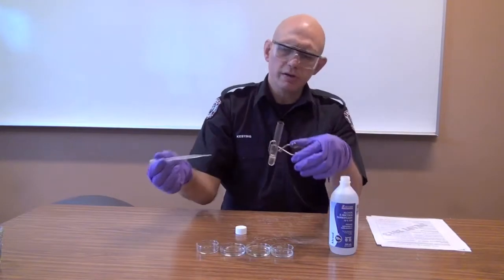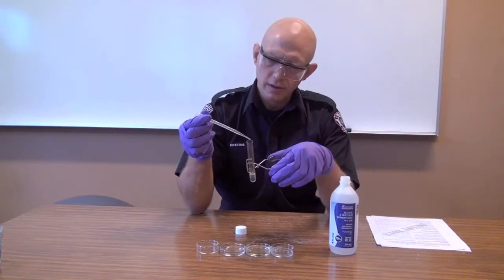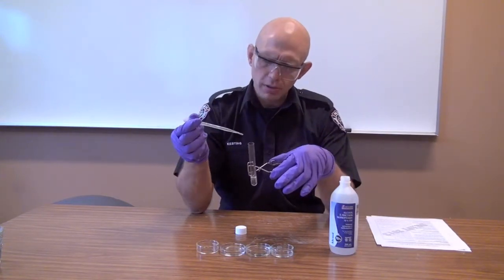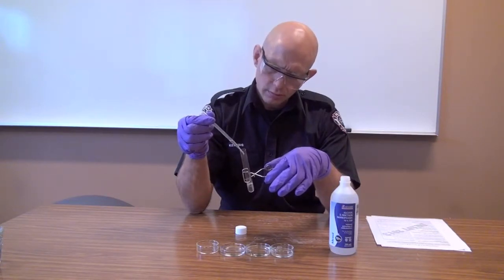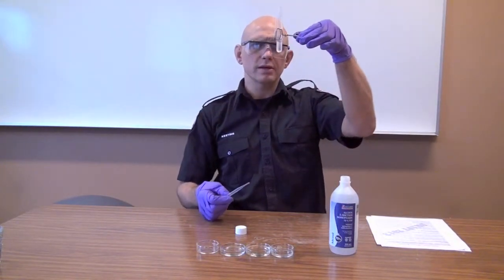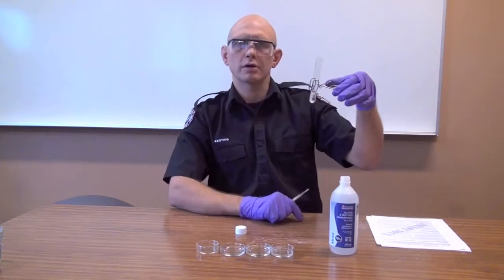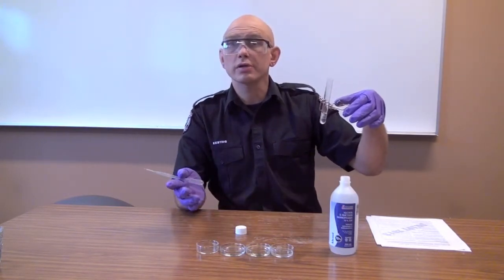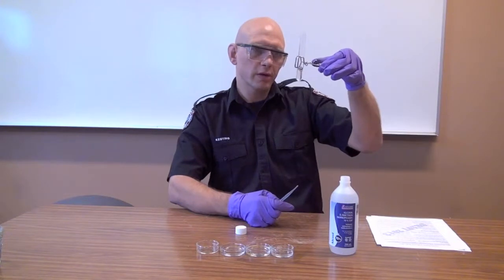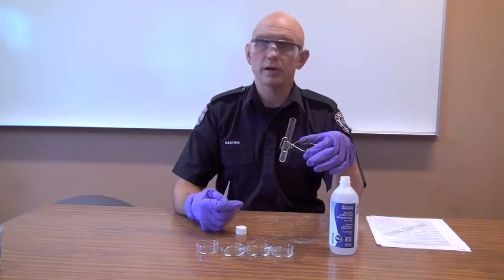We're going to add a little bit of the unknown liquid to the water. We're pointing this test tube away — point it towards your friend, not towards yourself. I'm going to add a couple of drops. I don't see any hissing, I don't see any bubbling, so I'm going to add a little bit more. You'll be able to see that this compound is mostly sitting on top of the water. That tells me that specific gravity is less than one, which can be really useful in trying to identify a compound. It also looks like it's beginning to mix with the water a little bit — it does seem to be miscible with water, at least to some extent.